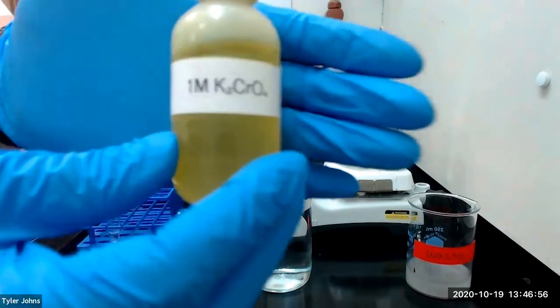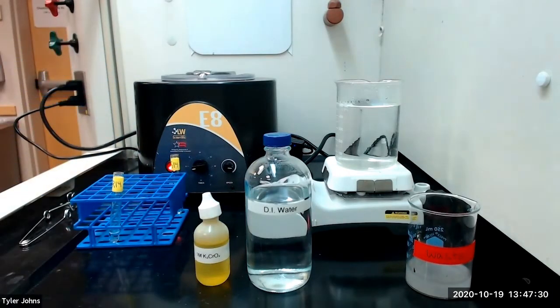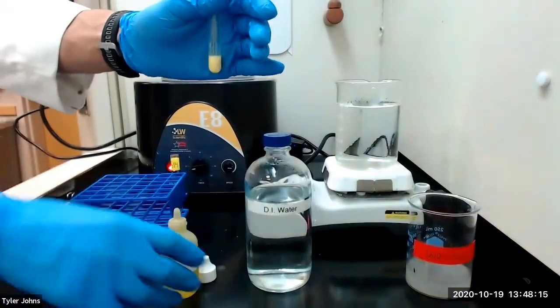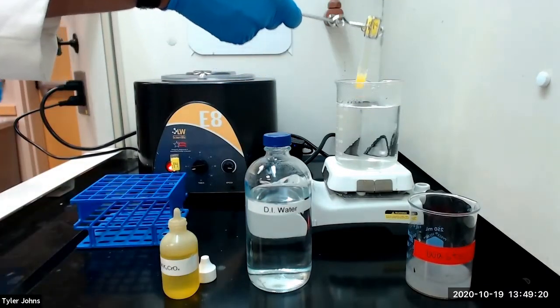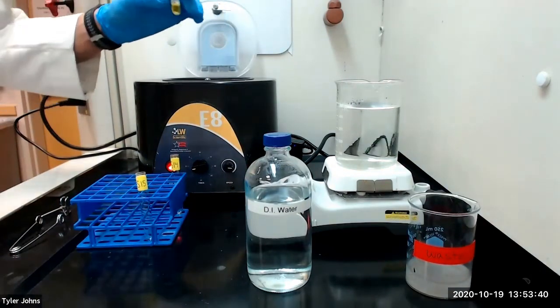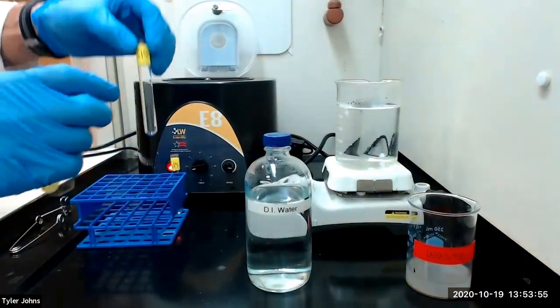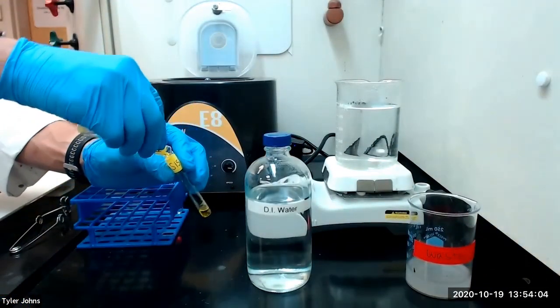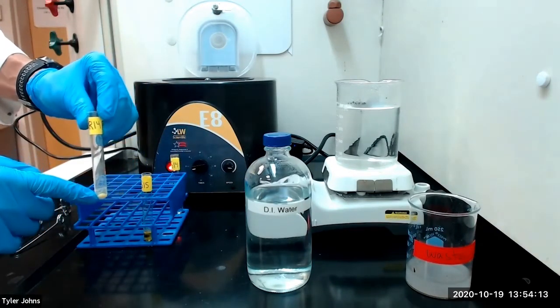We will next add three drops of one molar potassium chromate to our solution, then warm the mixture and centrifuge. This is what our mixture looks like after centrifugation. We will decant the solution into a new test tube labeled S15 and save the solution for the analysis of calcium ion. We will relabel our precipitate of barium chromate as R15.